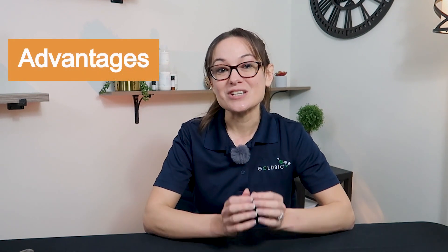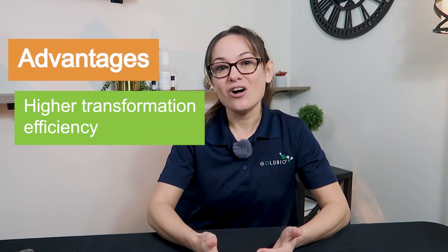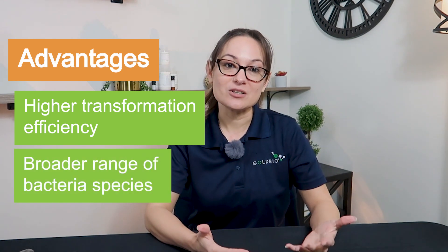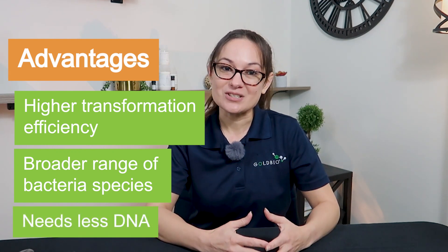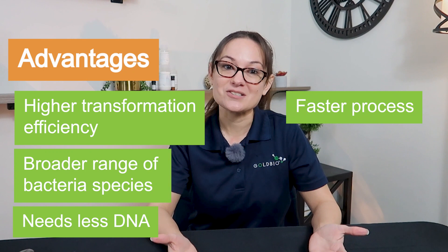So let's look at the advantages and disadvantages of electroporation. Right at the start, the big advantage is that transformation efficiency. It also can work with a broader range of bacterial species, including bacteria with cell walls. You also don't need as much DNA compared to heat shock transformation. And finally, the process is faster.